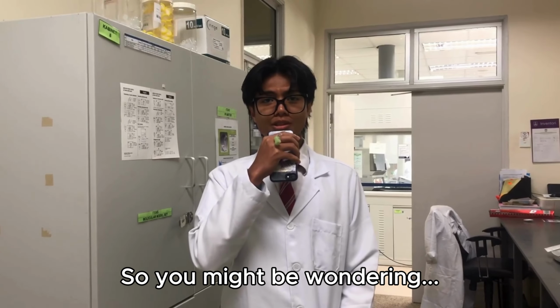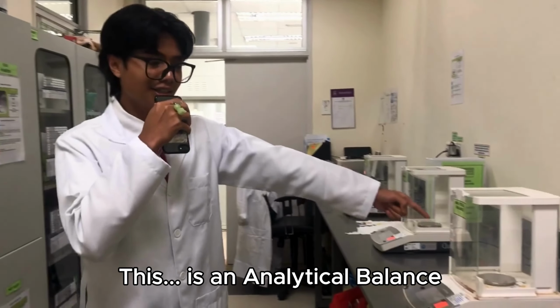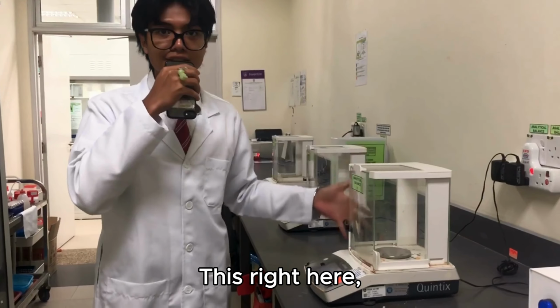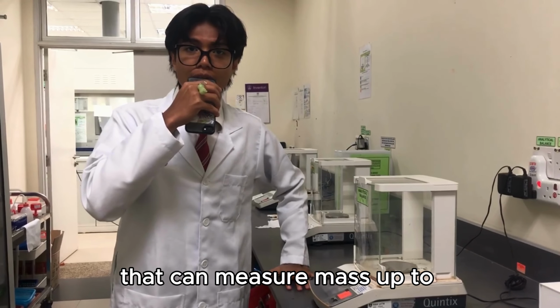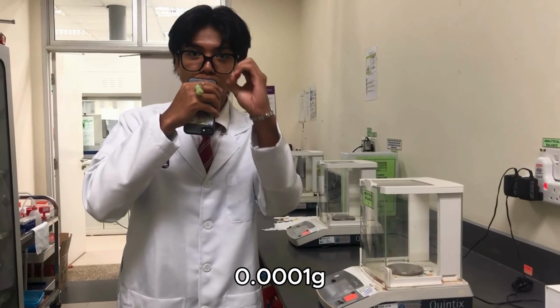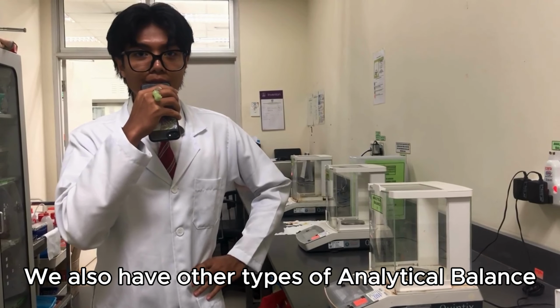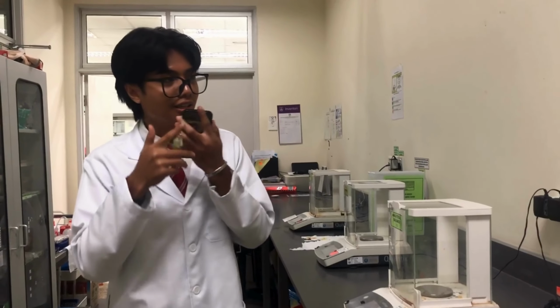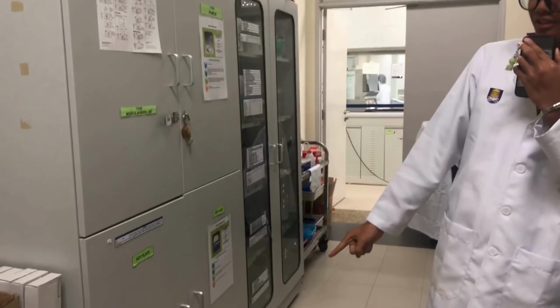So you might be wondering, what is an analytical balance? This is an analytical balance. This right here is a highly sensitive laboratory instrument that can measure mass up to 0.0001 gram. We also have other types of analytical balance, which is this, and also this.